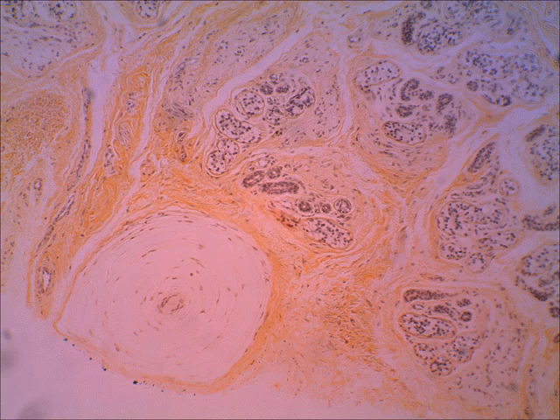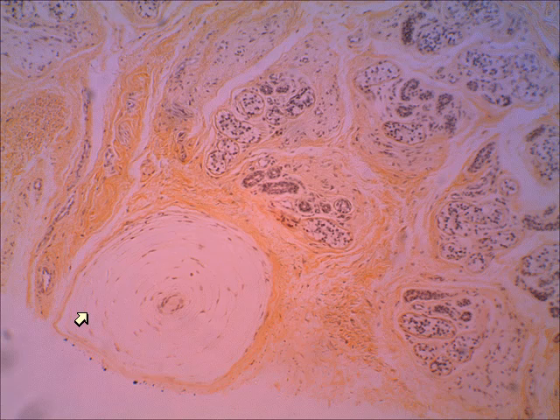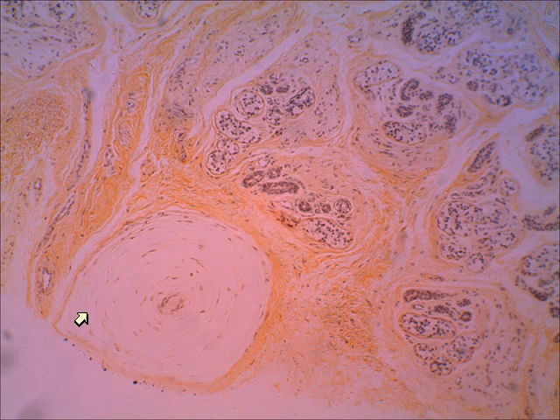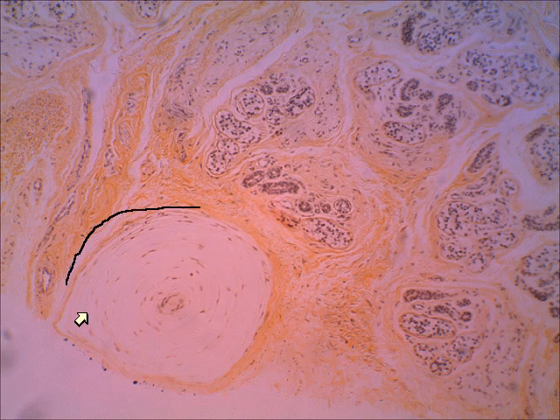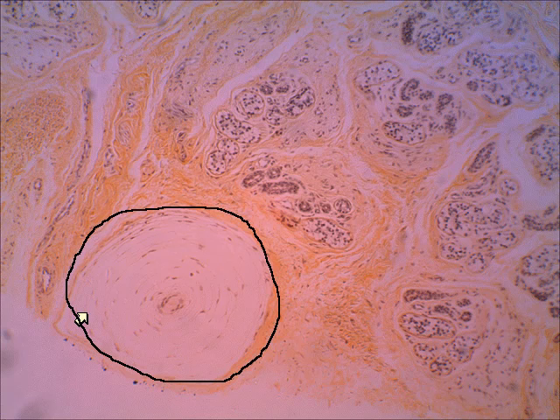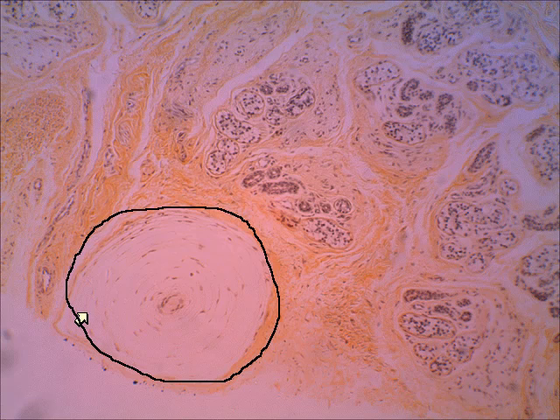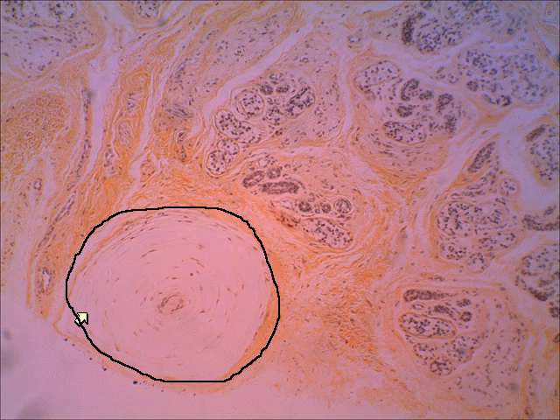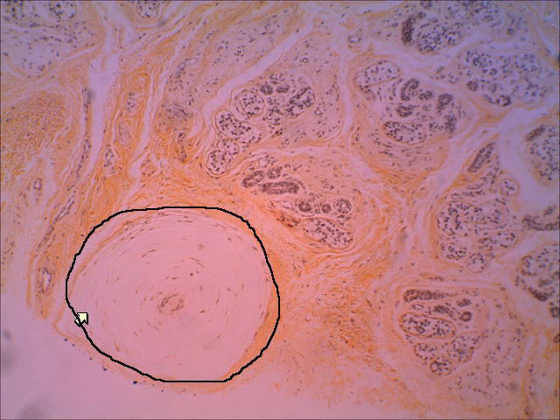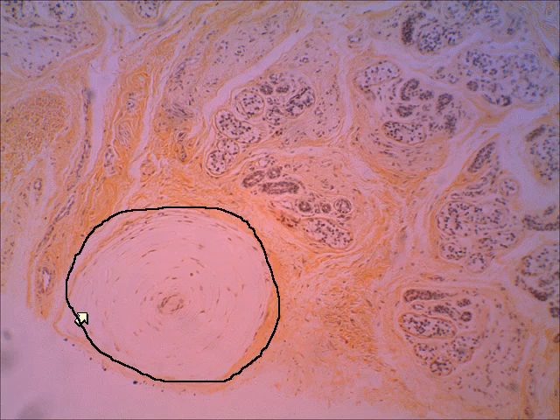There it is. If you look right where the arrow is — all of this area, and this is pretty large — all of this is a pacinian corpuscle. It's sensitive to deep pressure and to vibration. It can be found deep in the skin.